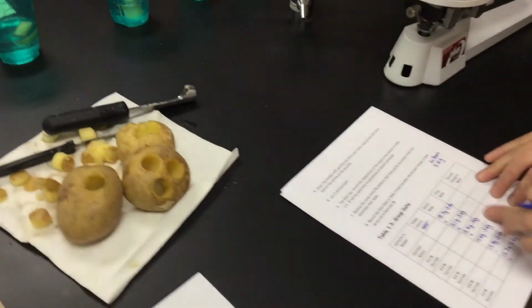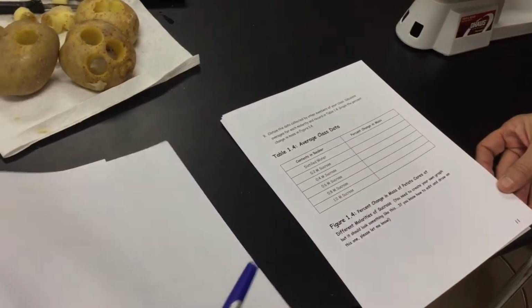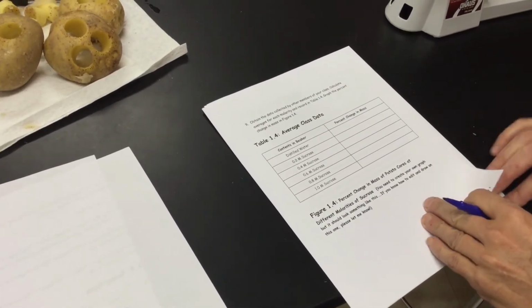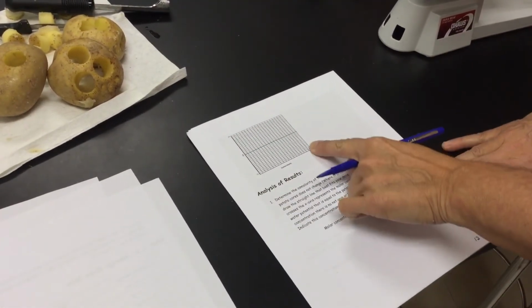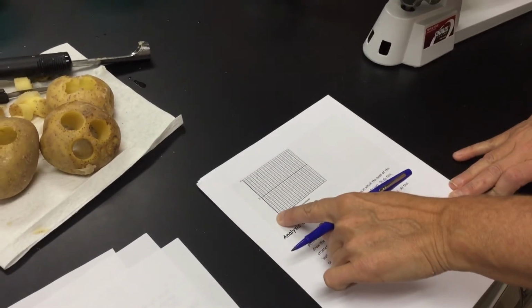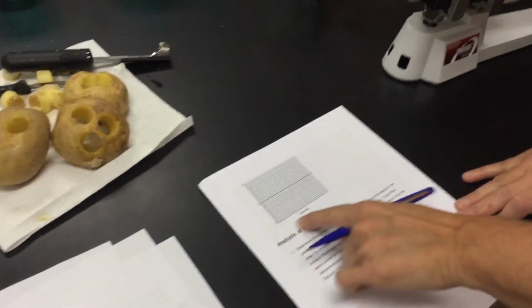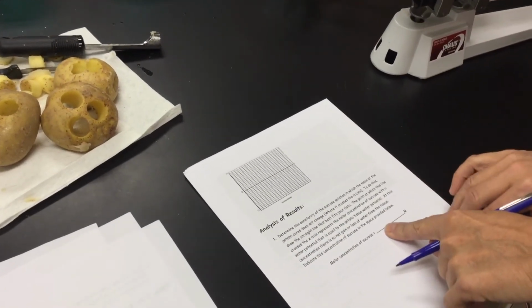So we'll come back, we'll do our final mass, which will give us the same formula for percent change in mass. There will be a little extra credit, and we'll just move our data here for everybody. So this will be your final data when we get there tomorrow. You guys are going to go through and create your own graph. I'm going to give you an example of what it looks like, because we're going to have a positive change in mass and a negative change in mass. So wherever that line crosses 0 is going to be your molarity of sucrose. It's going to be your molarity of that particular potato, which is what we're going to be putting here.